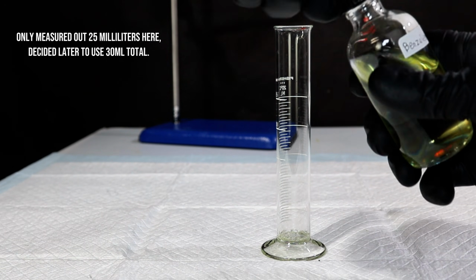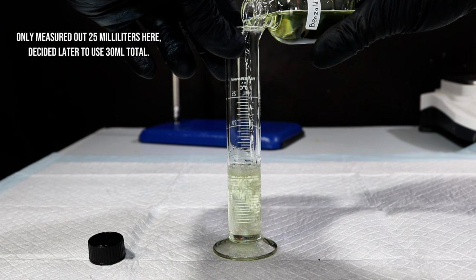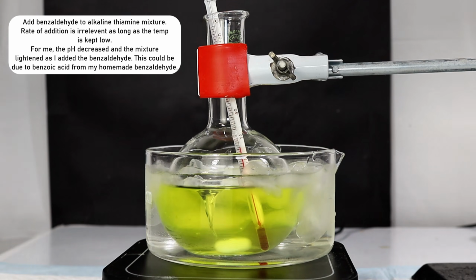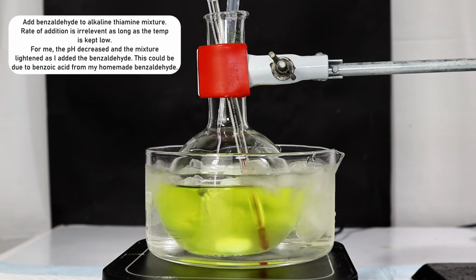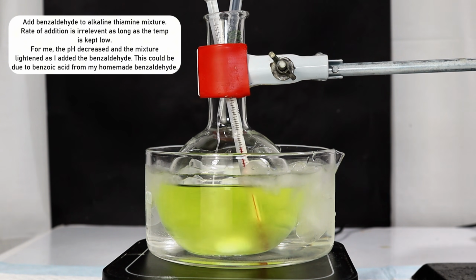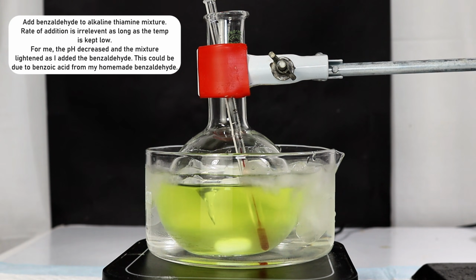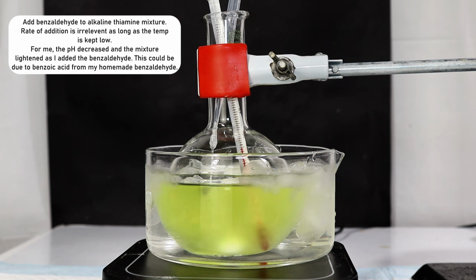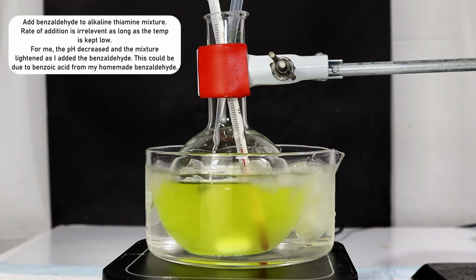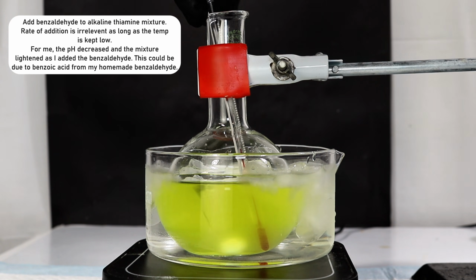I then measured out 25 milliliters of my benzaldehyde and began to slowly add it to the yellow mixture. You'll notice that as I add the benzaldehyde, the mixture lightens up somewhat, and I correct this by adding a few extra drops of the hydroxide. I'm not really certain whether the pH drop during this step is normal or because my homemade benzaldehyde contains some benzoic acid impurities. In either case, it's very important that the pH is still between 9 and 10 by the end of this step, and this can be indicated by the bright yellow color of the active carbene.